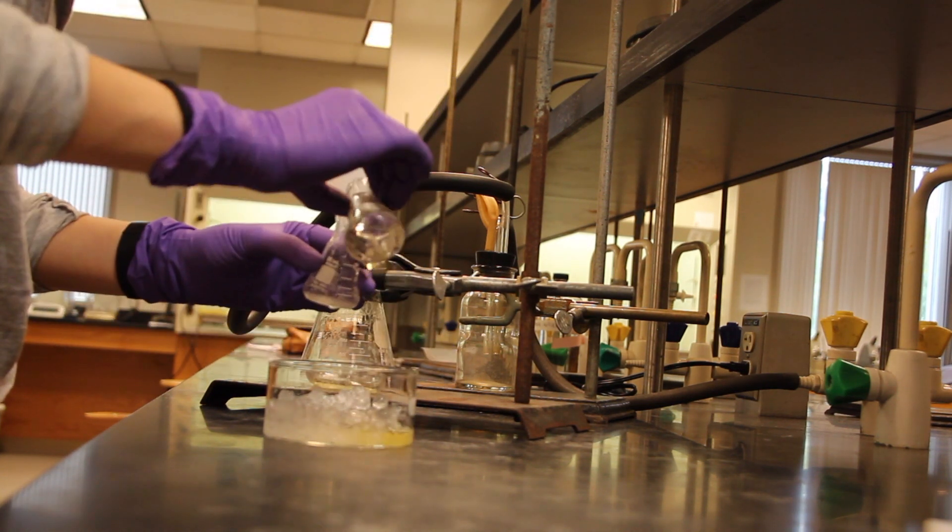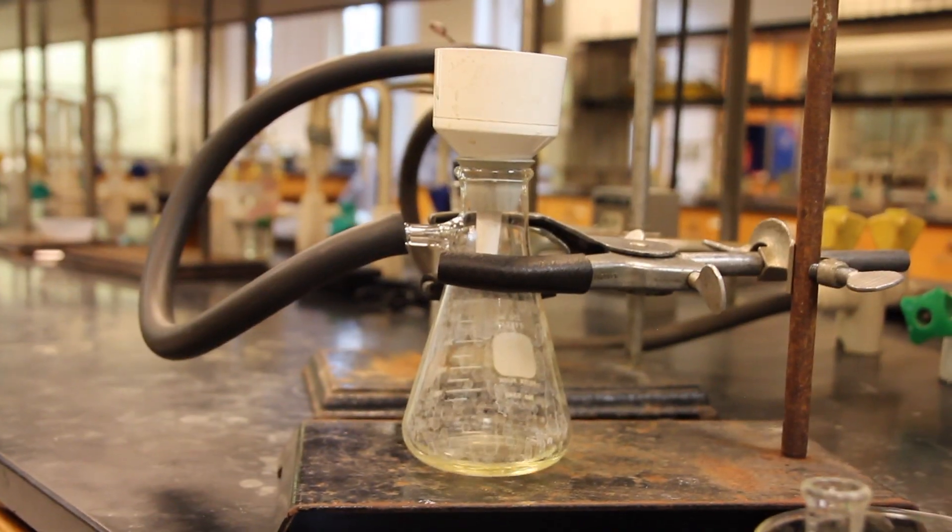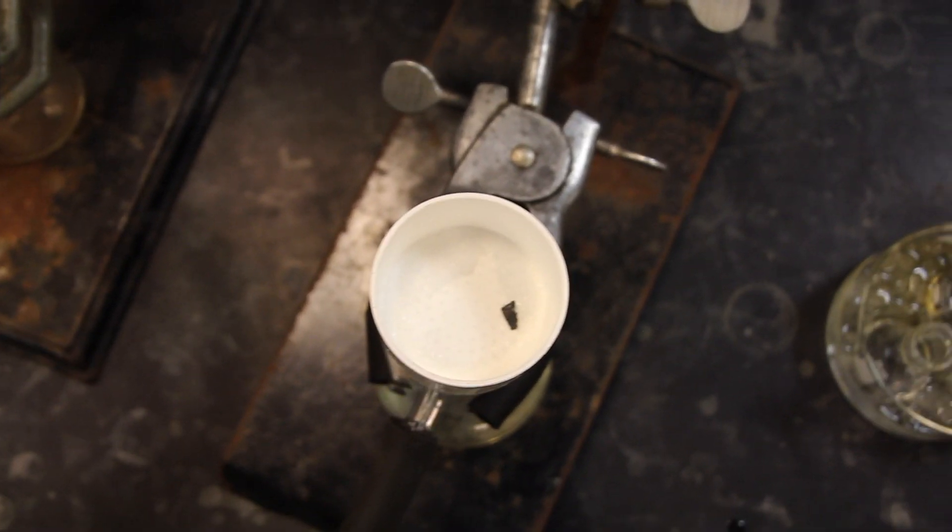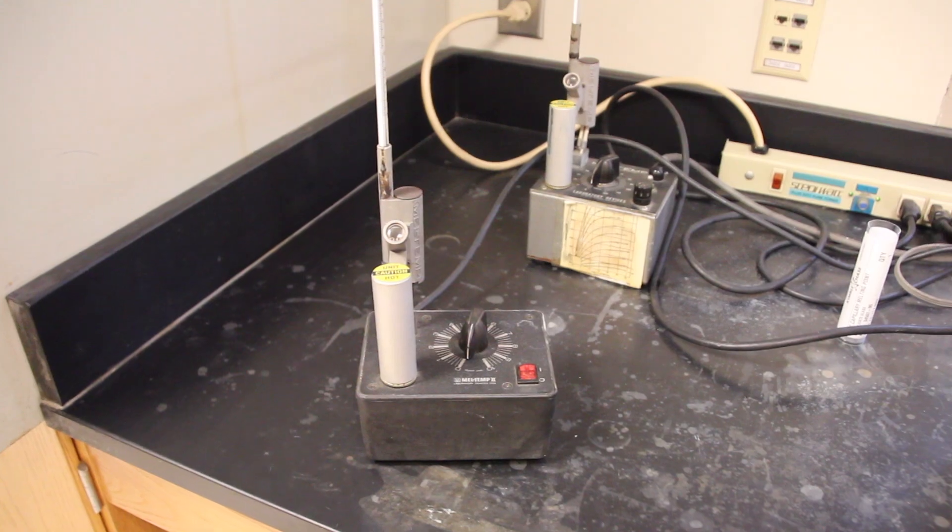Use suction filtration to isolate the solid product and rinse your crystals with ice-cold solvent. After letting your crystals dry, obtain the melting point of your product and calculate the percentage recovery.